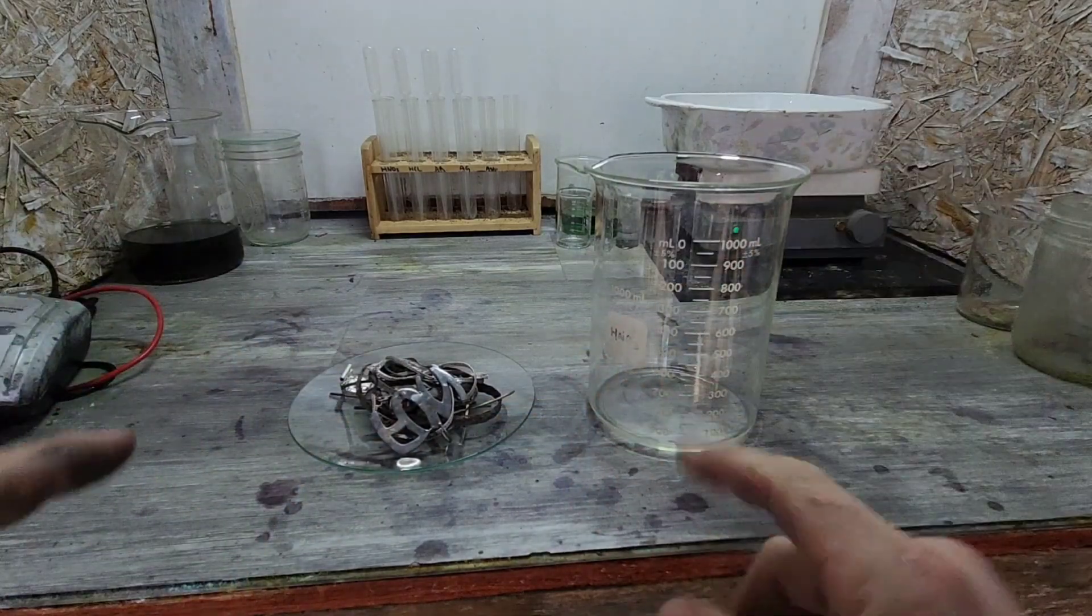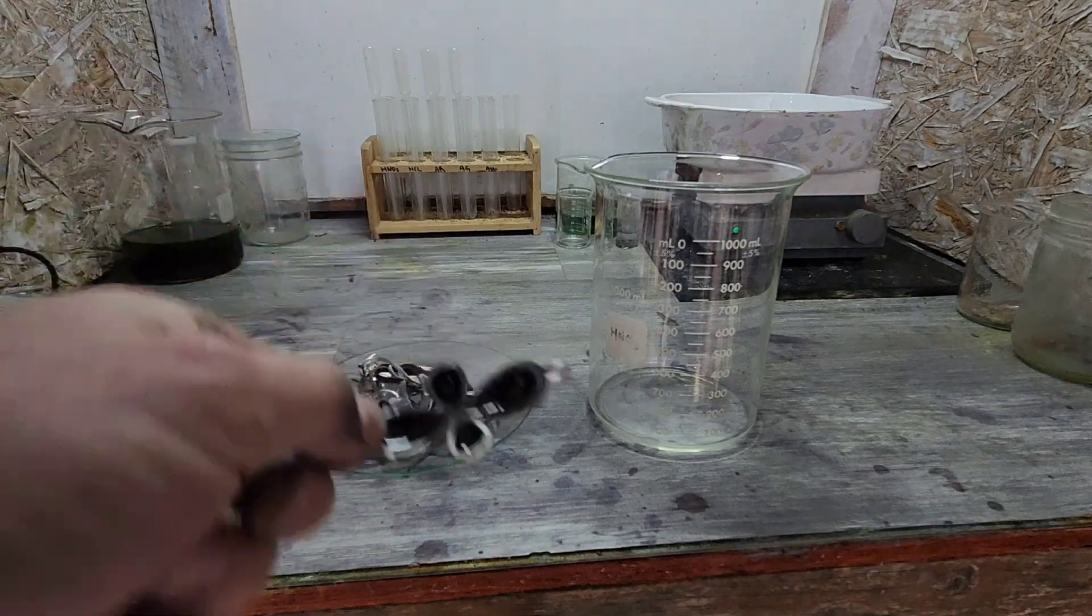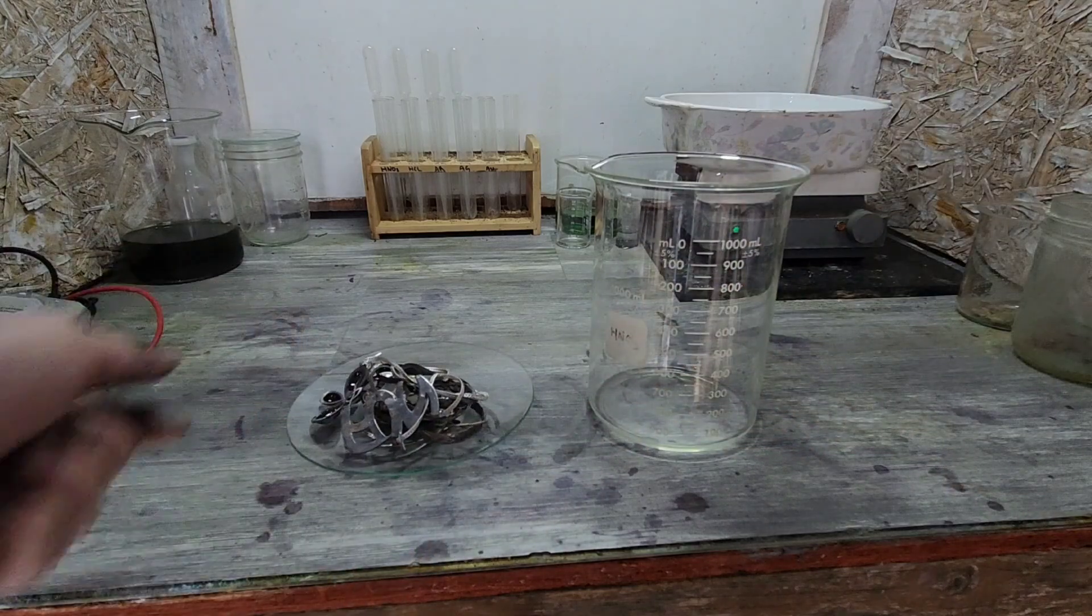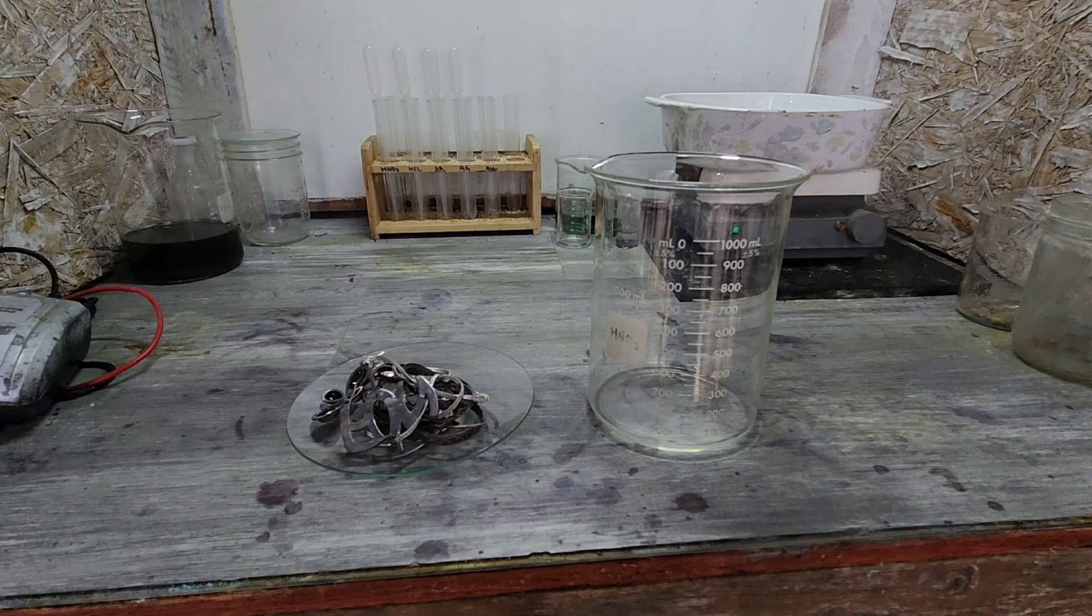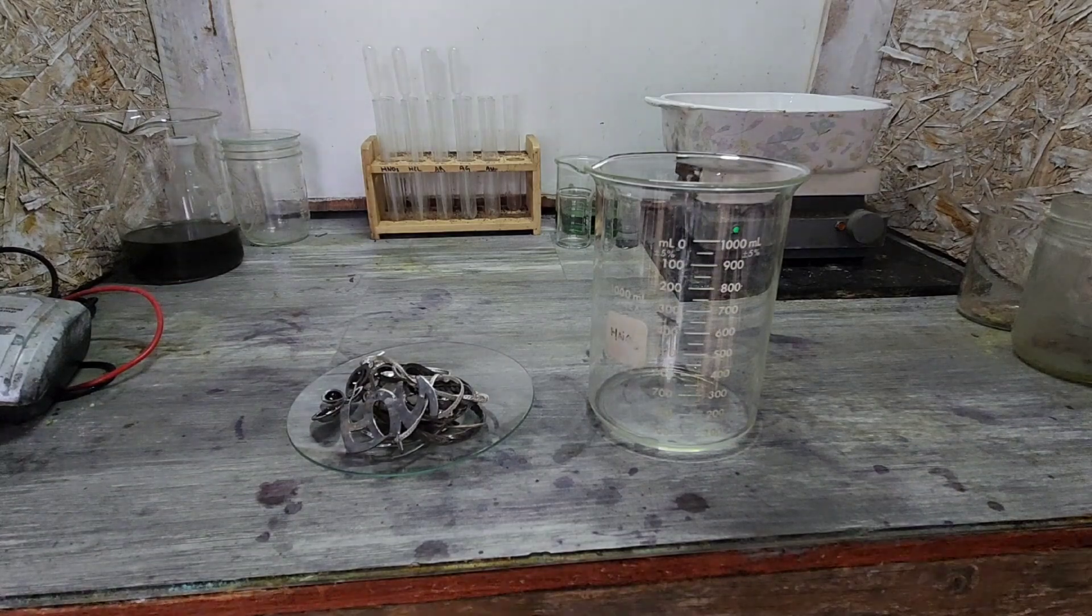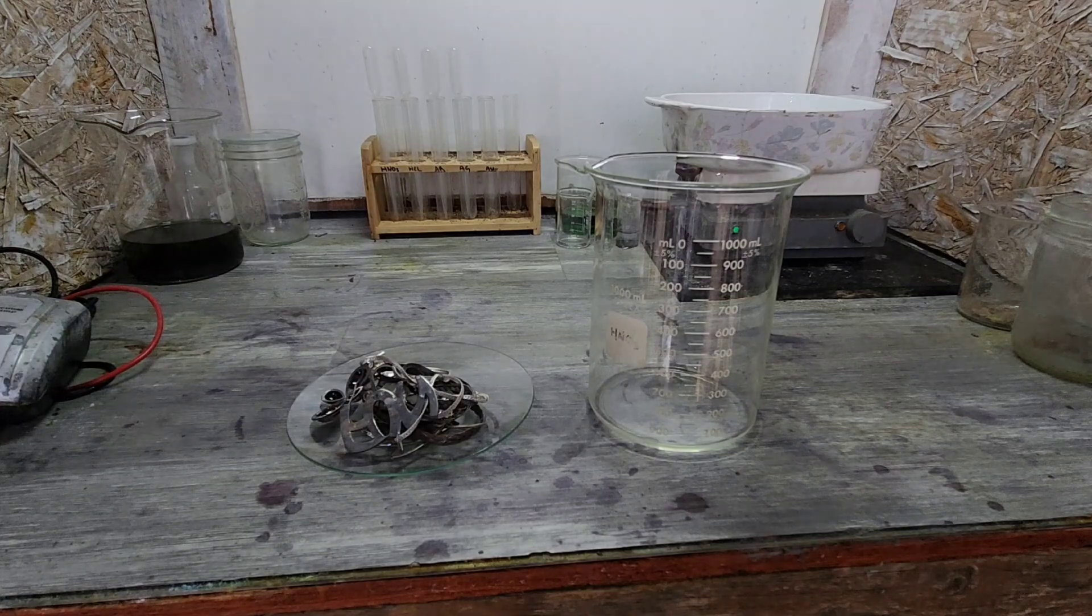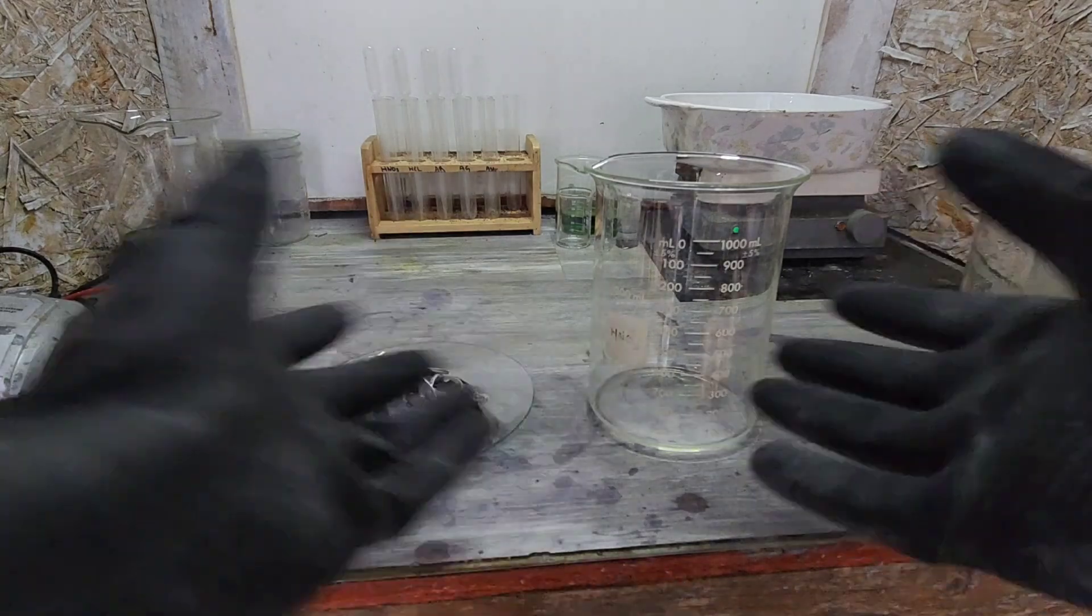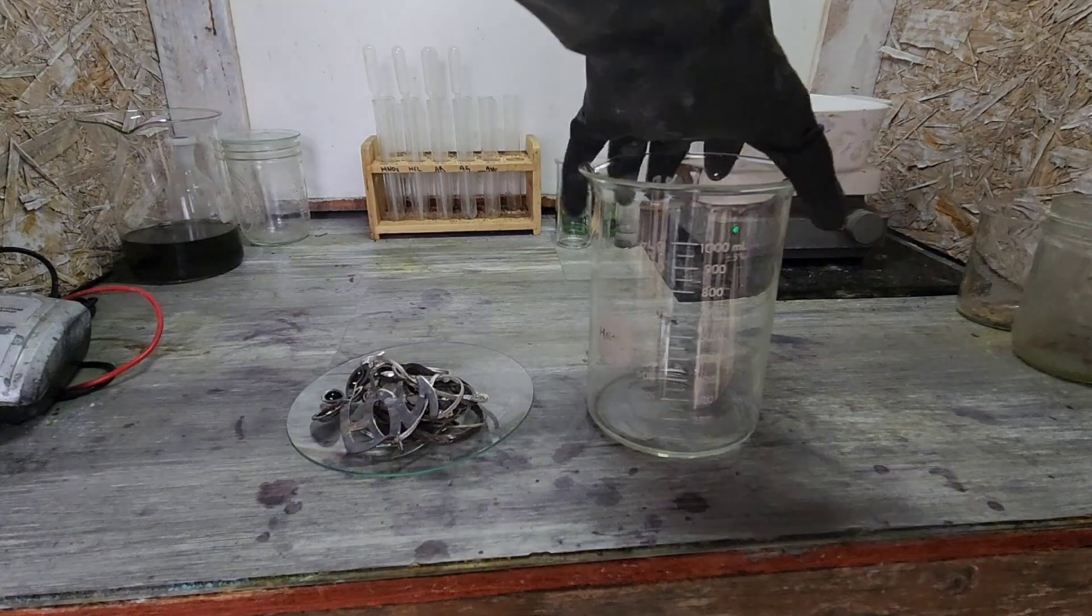There's only one piece that I couldn't get the stuff off, and I'm not sure if that's epoxy in there or what it is, but it is a major pain in the rear. So we're gonna see how it reacts to nitric. Hopefully the metal just dissolves and we can filter the chunks out.